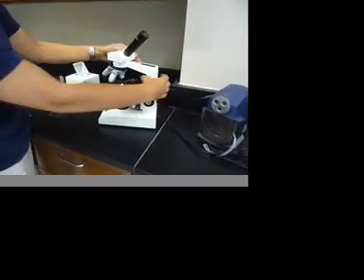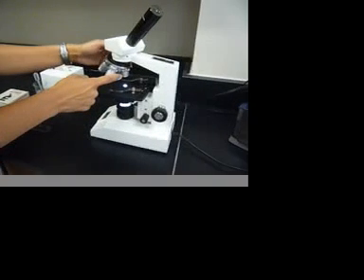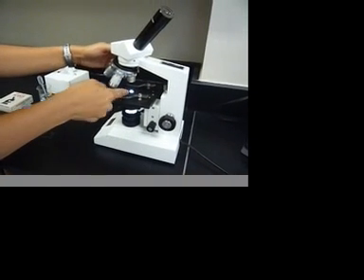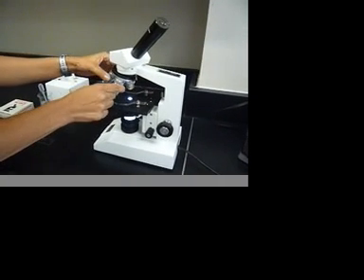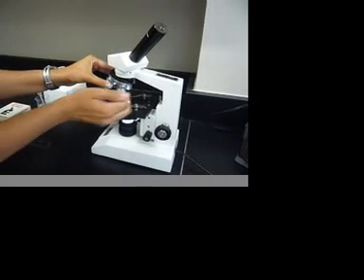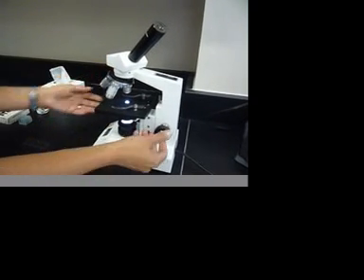Always make sure when you get your microscope, the lowest powered objective is on facing the lens. You never want to have one of these bigger ones engaged when you're going to first put a slide on.